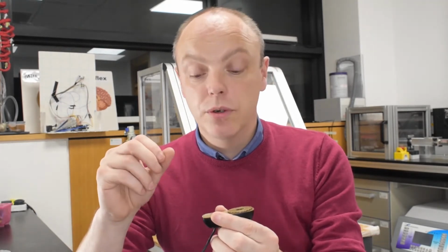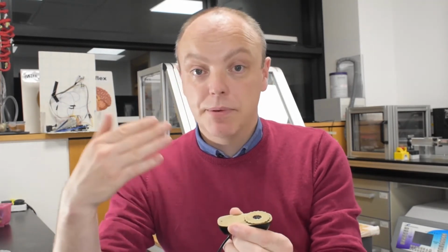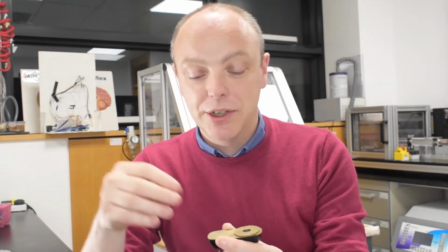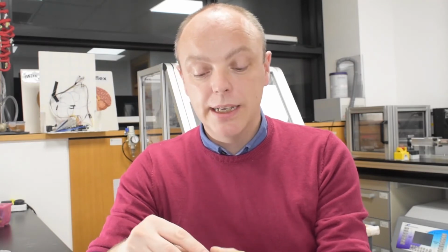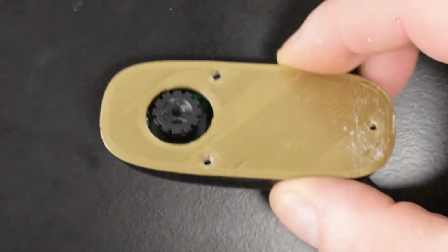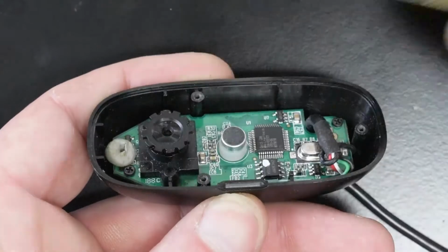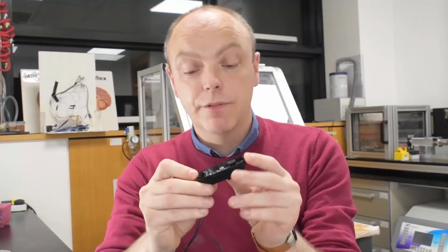Now, when you buy one of these webcams, there's a plate mounted on the front, which you can just unscrew. I'd show it to you, except years ago I lost it, so you have to use your imagination. There are 3 screws which hold it in place, and we've actually replaced it here with a little 3D printed part. The screws are removed, and then if you take that off, you can see the actual device itself.